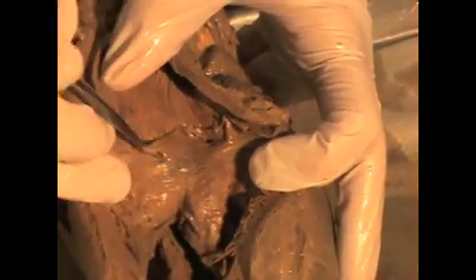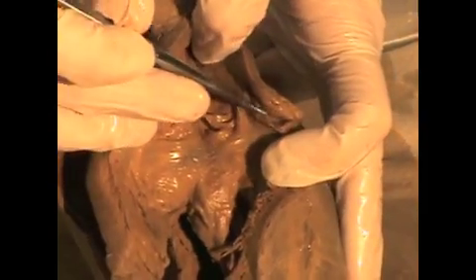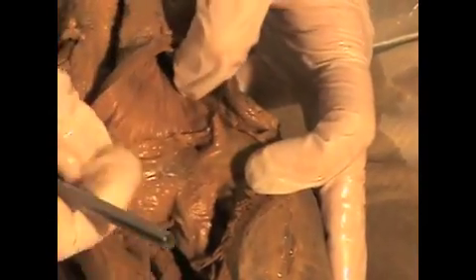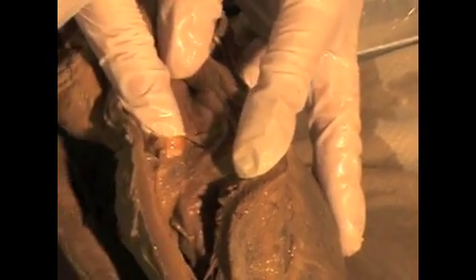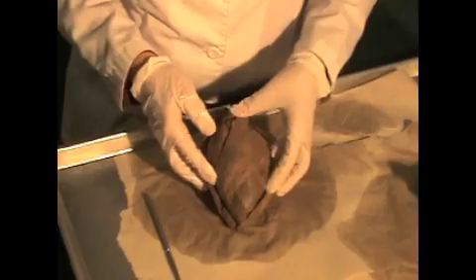Someone thinks they look like half moons, so hence the name. And you've got three of them, and the one has been sliced through because we've opened it up. But this is the pulmonary semilunar valve. When the pressure changes as the ventricles relax, blood's going to want to flow backwards, and it gets caught in these pockets, so they prevent blood from backflowing.